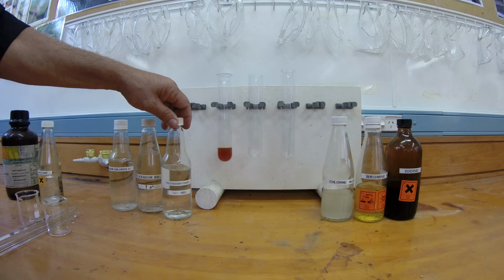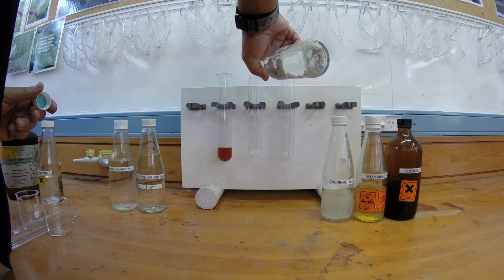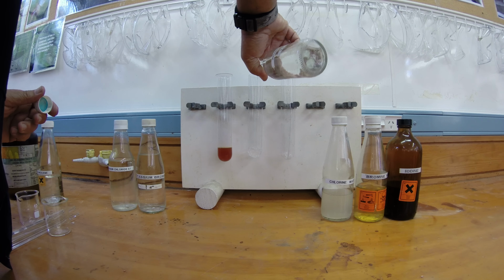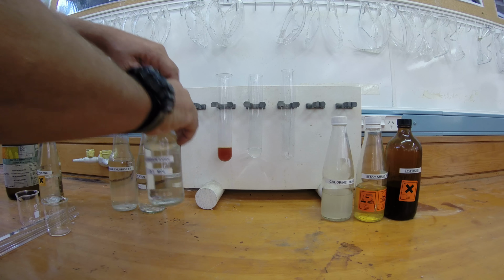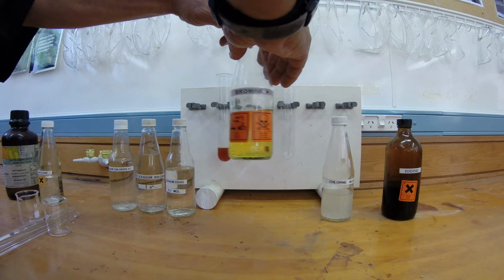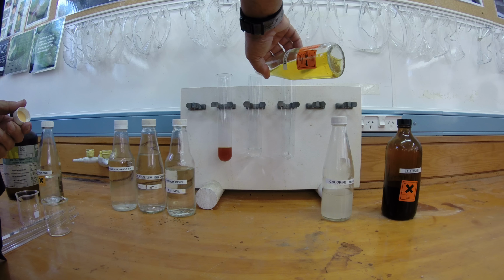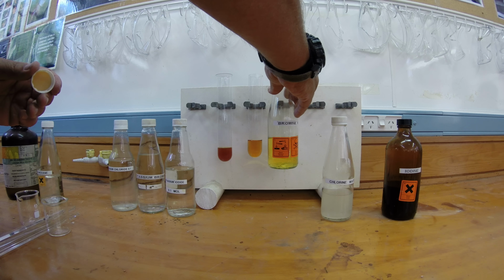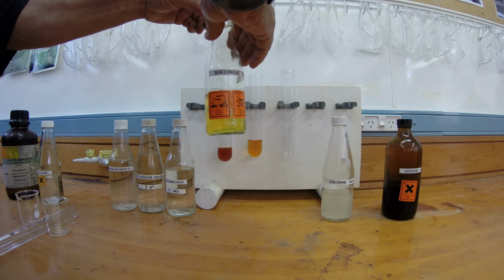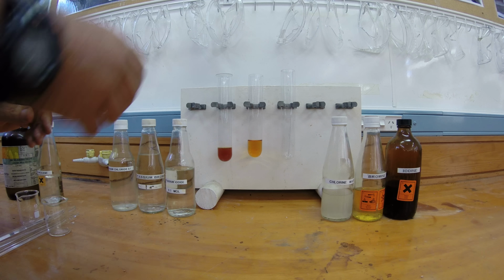So if I take potassium iodide again into the second test tube, this time I react it with bromine water. This is quite weak bromine water, but you can still see the colour. If I put some of that in there, again you can see that it's a much darker colour, heading towards brown rather than orange, so that means that a change has occurred.